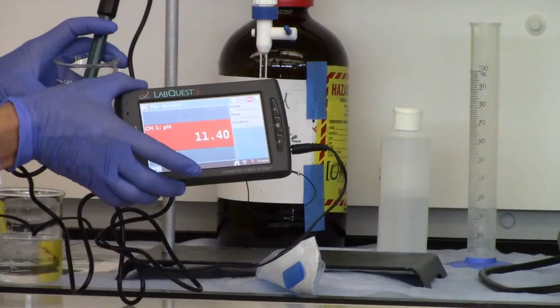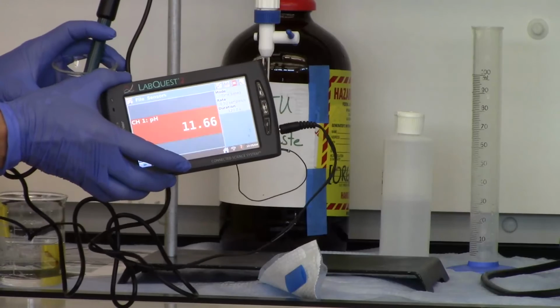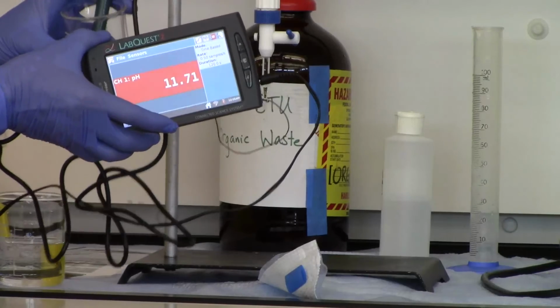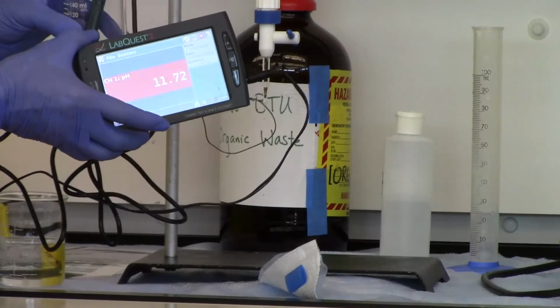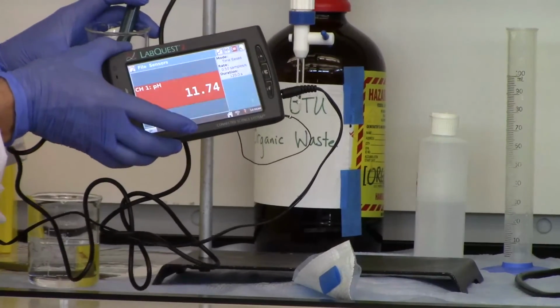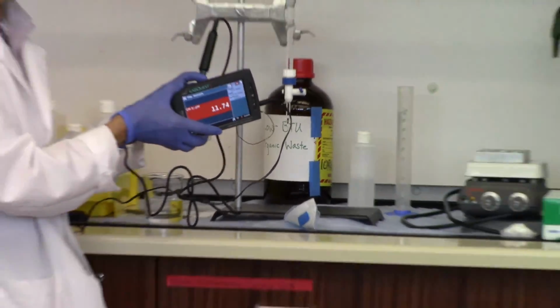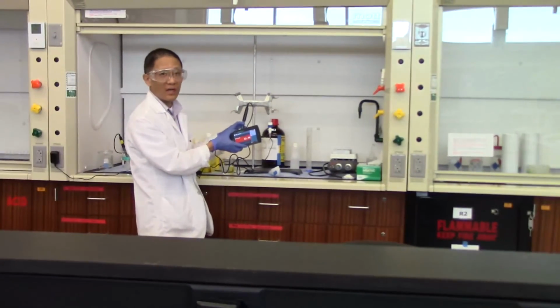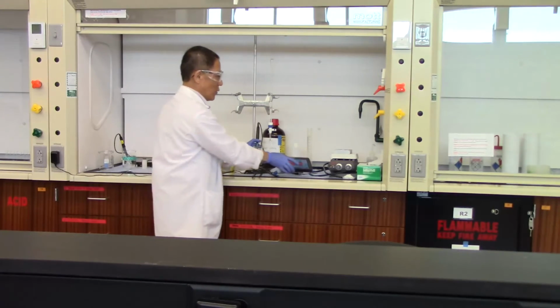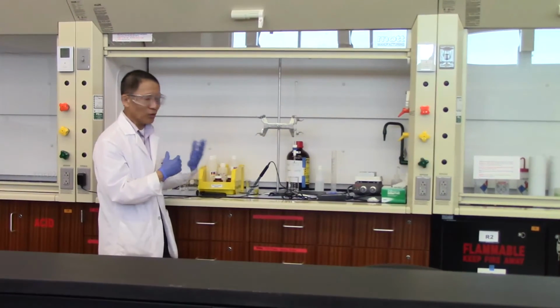So we start with a pH around 4, which is not an accurate number to begin with. For deionized water, it should be somewhere around 7. But in any case, when we added 1 milliliter of the sodium hydroxide into that 25 milliliters of water, you see the pH went from 4 all the way up to 11. So in this case, the pure water does not have any capability to resist the pH change. Once you put a small quantity of acid or base in, you are going to see a drastic change in pH. So that's how the buffer and the pure water work.